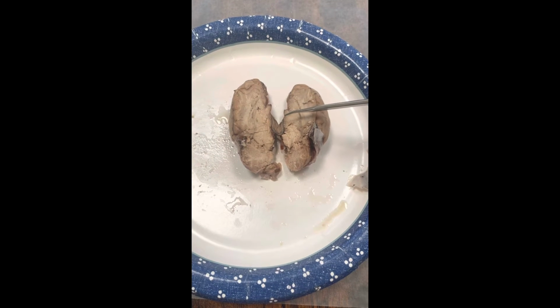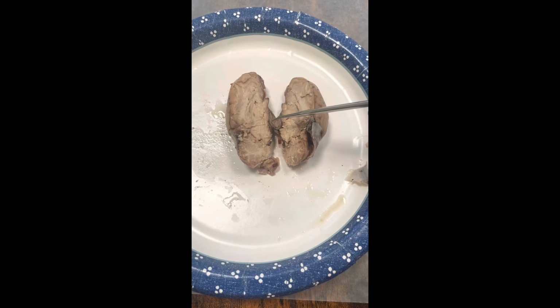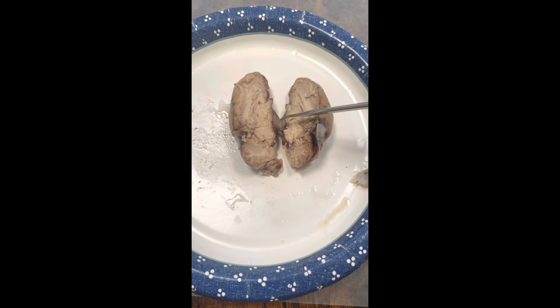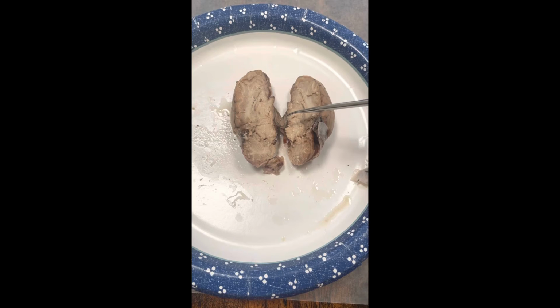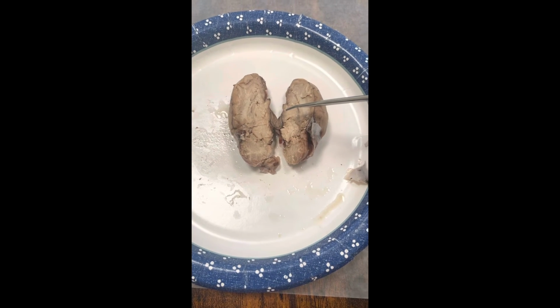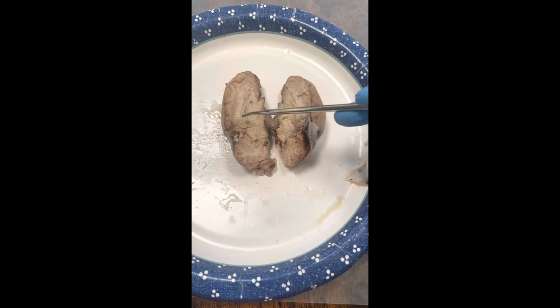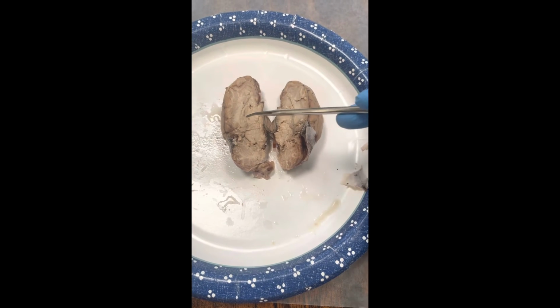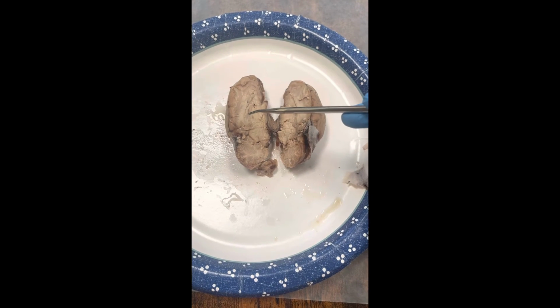Okay, here we would have the optic nerve, the pons, the medulla oblongata, and the temporal lobe would be located just about here. Since this is the inferior view, it's kind of hard to tell, but it would be along the side of the head.